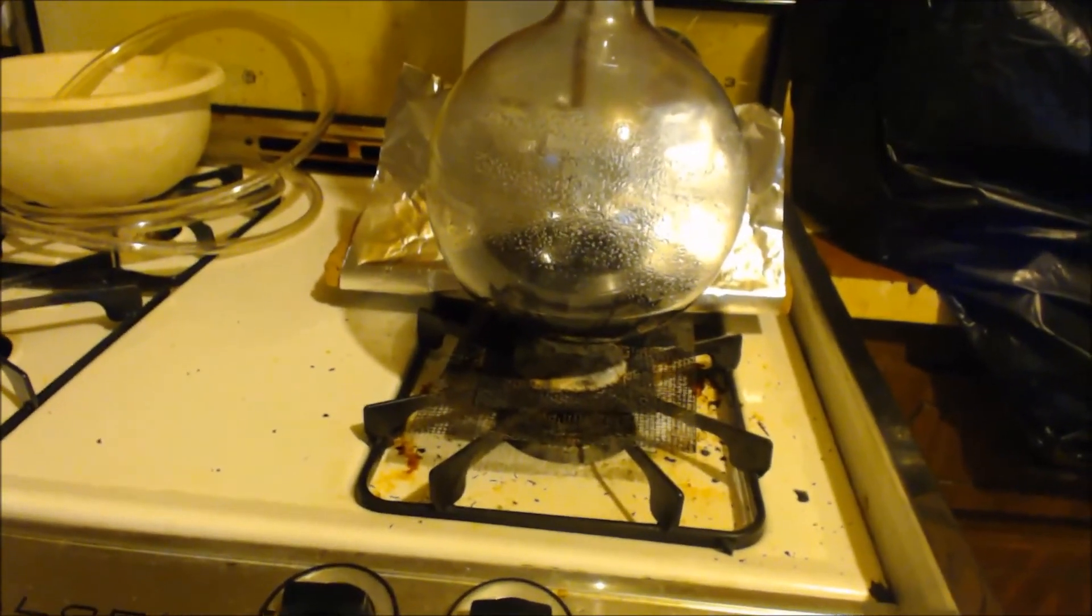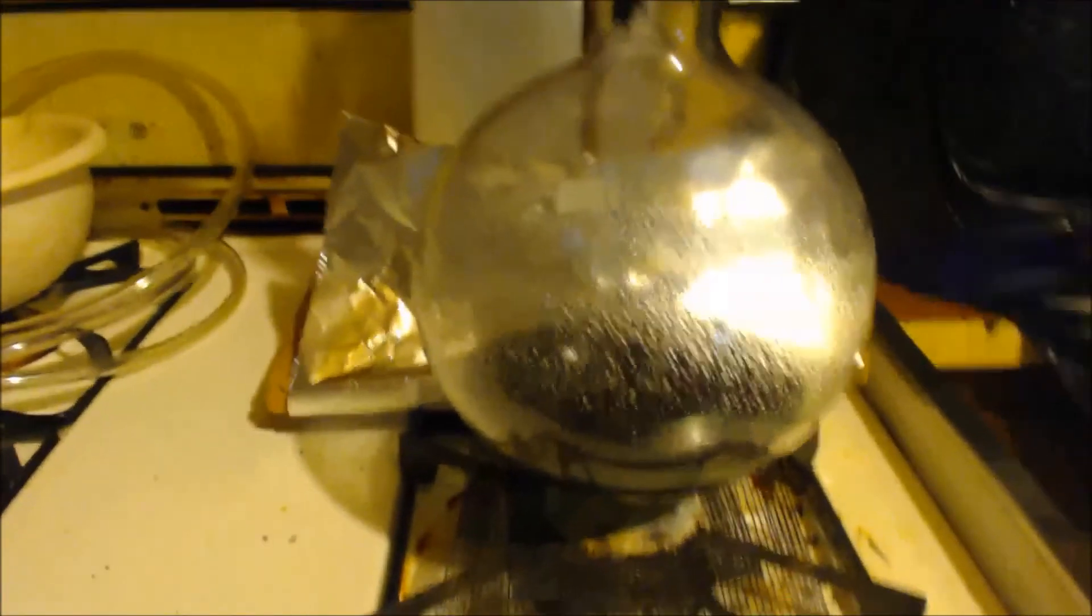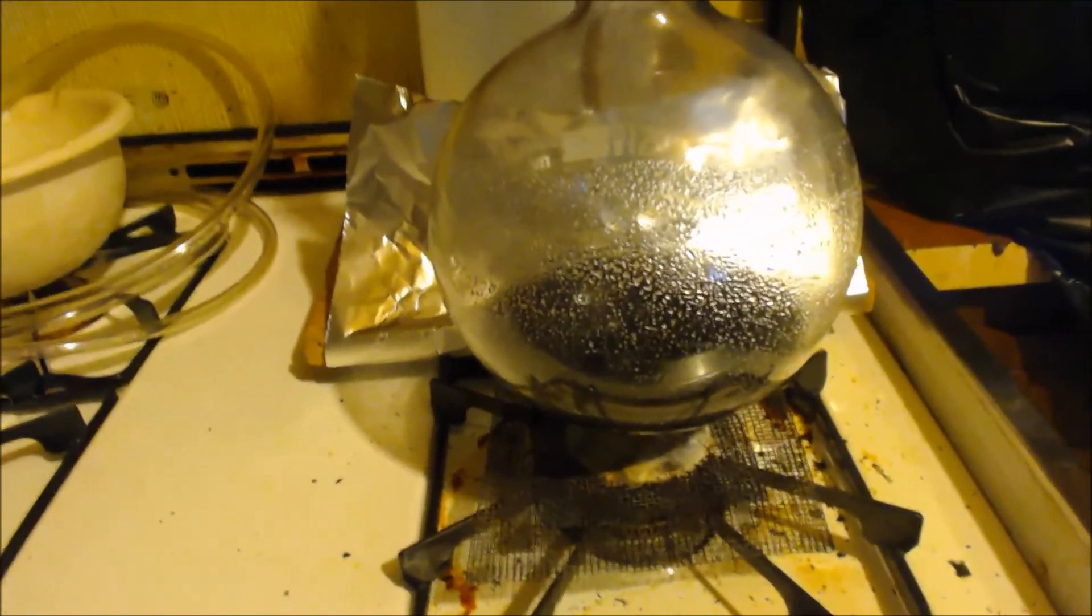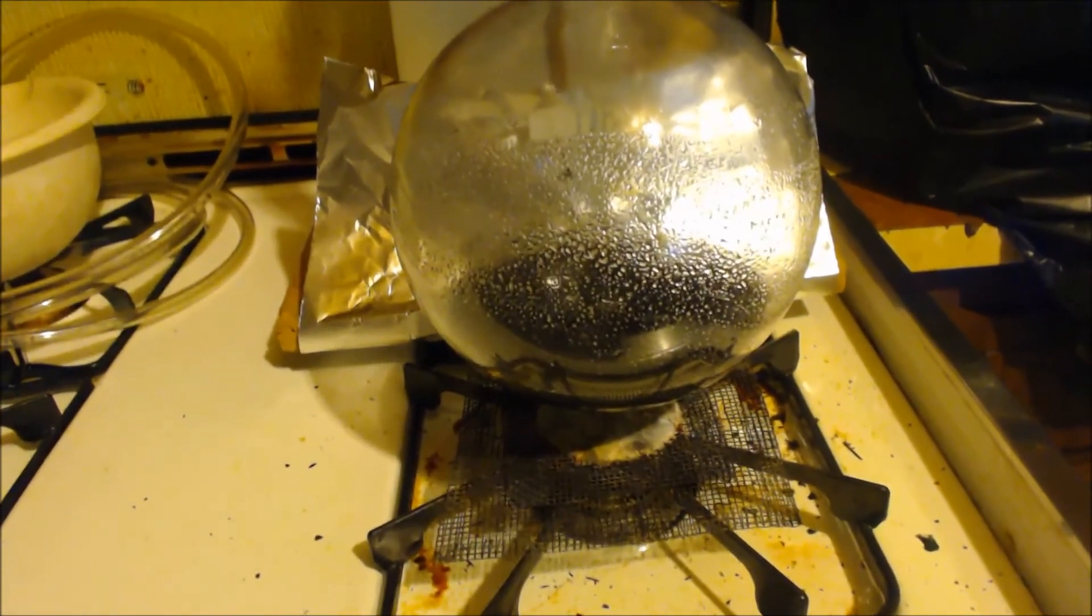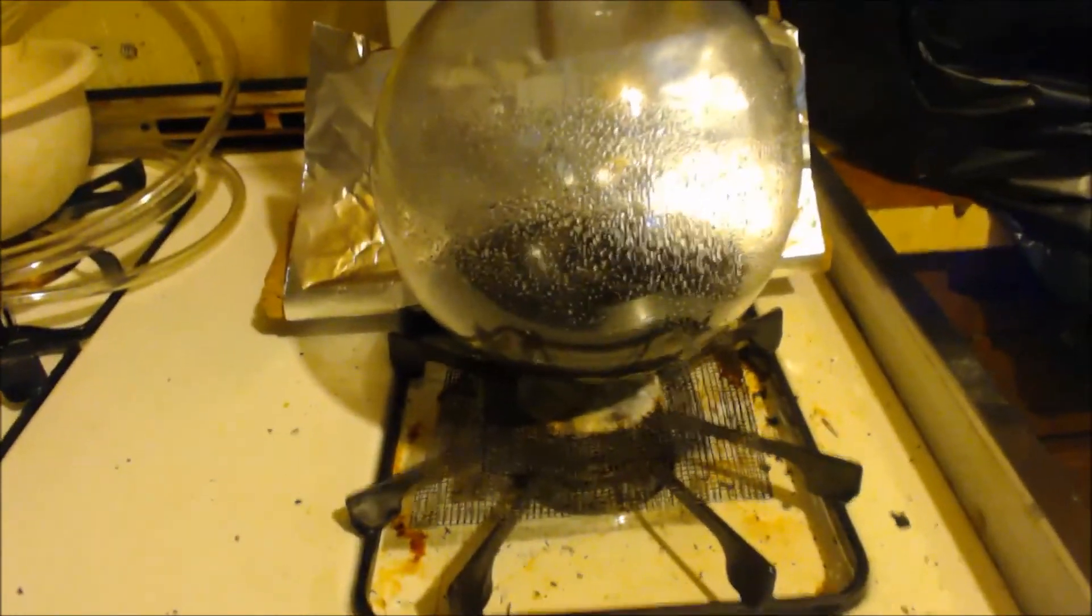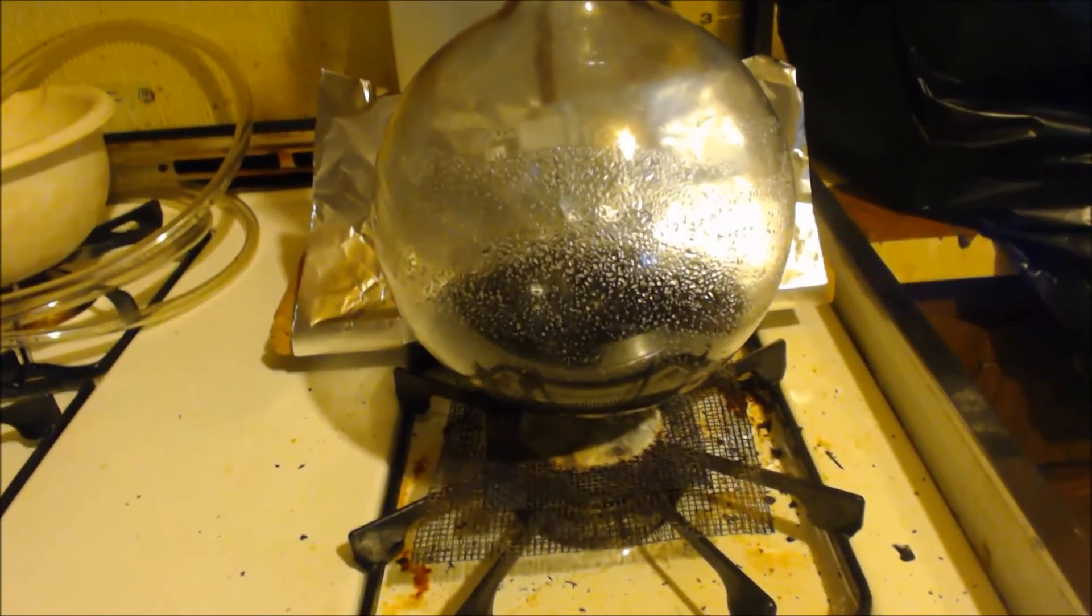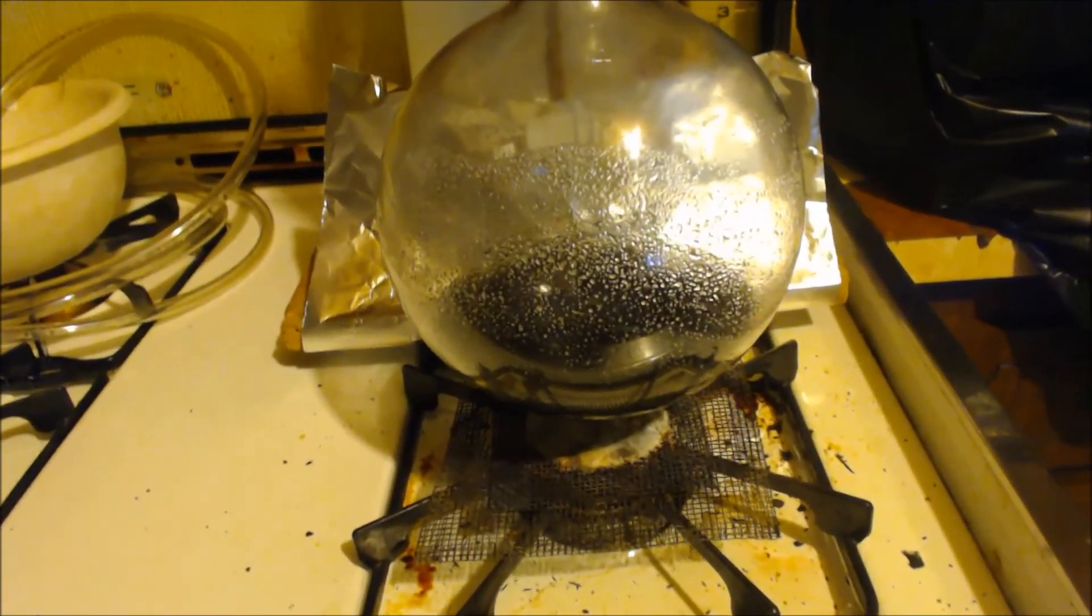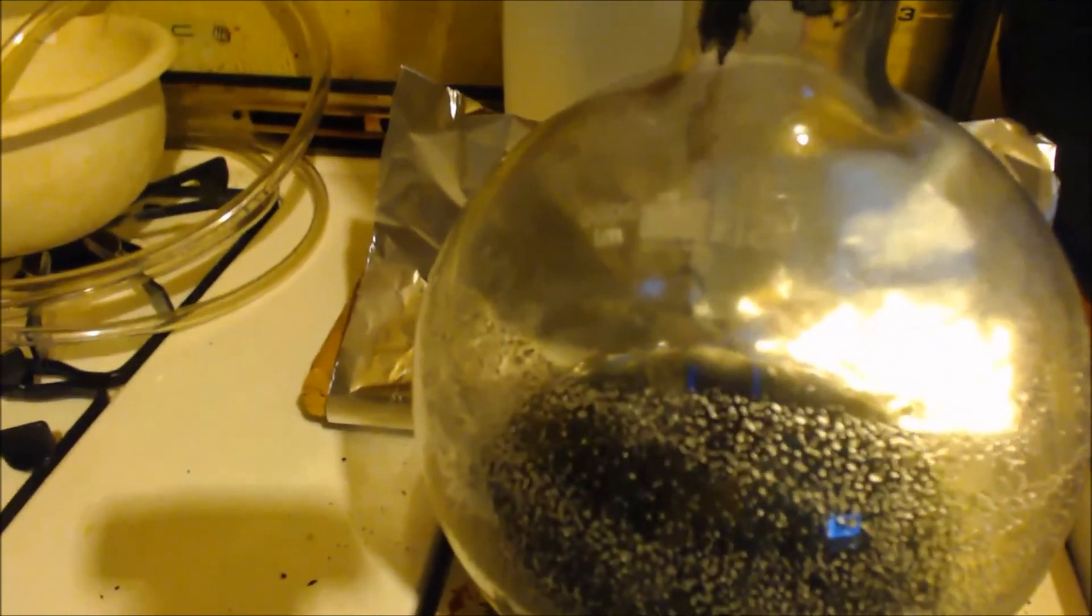Funny is this, the smell. What's funny is the smell that I smell is the same exact smell when I make chromium chloride. I put chromium metal inside hydrochloric acid. So I mean, if it's SO2, why did it happen? There was no sulfur-containing products in chromium or hydrochloric acid. So why does it smell the same if it's SO2? I don't understand that. Unless I'm using chromium metal and I just think it's iron metal. I don't know what the deal is with this experiment so far.